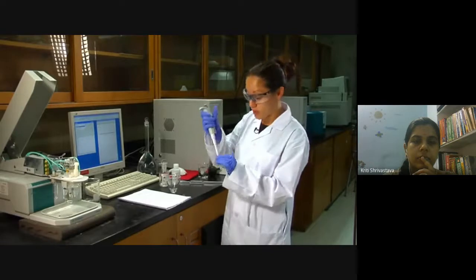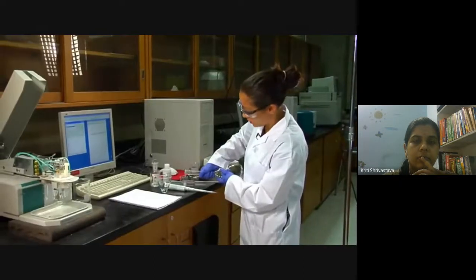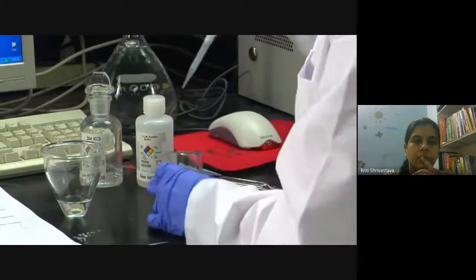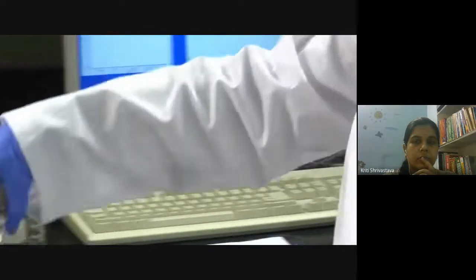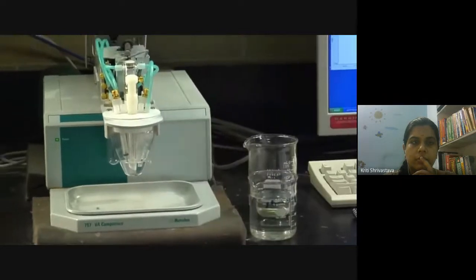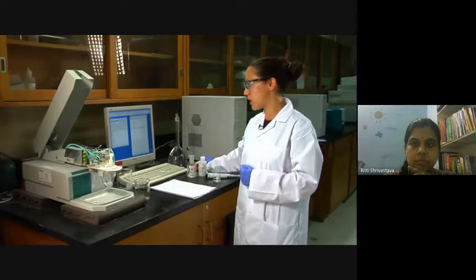The last addition will be your unknown, which is highly diluted. Get a small beaker because it is hard to pipette out of the narrow flask. Take about 0.1 mL of the unknown. Now your sample cell is prepared. Go back to the DP-ASV instrument and switch your beaker for your electrochemical cell — it is a small volume but the electrodes are deep enough to be submerged. That is it in terms of sample preparation and preparing your electrochemical cell.